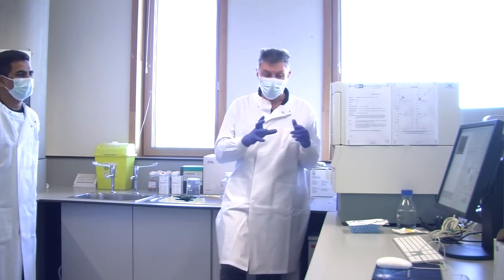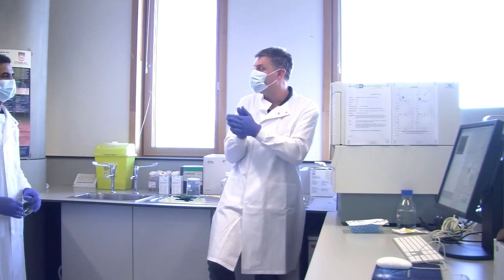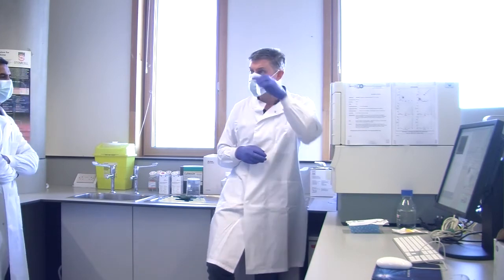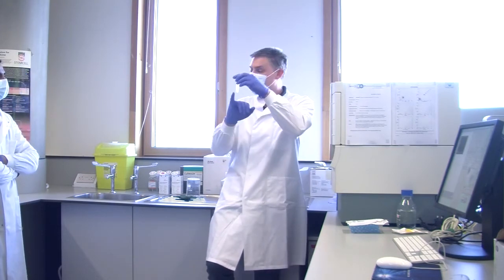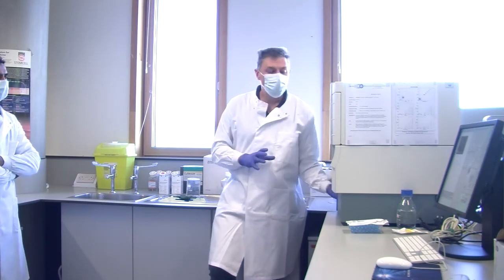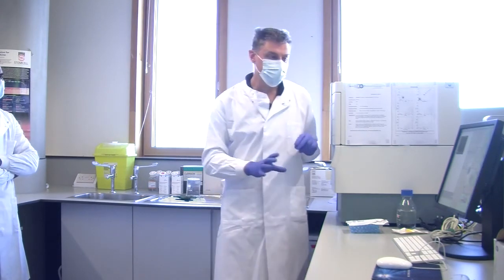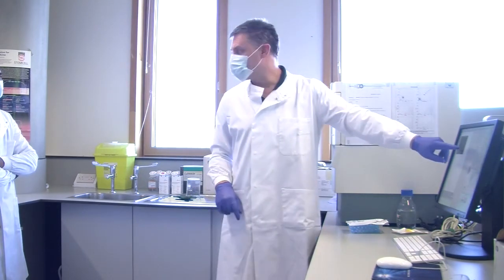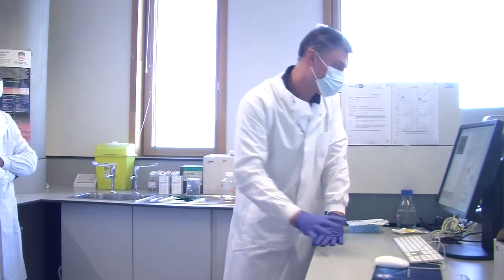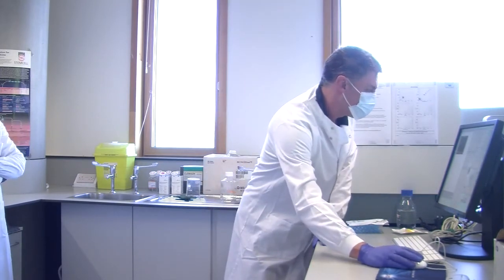Now, normally, if we put a tube of cells on it, they will be cells. But not every single event that goes through is a cell. If I put on my QC tube, these are beads, but they still come through as events. So you've got to remember that not every dot you see will be a cell. But each one of these dots, you can't really zoom, you can zoom in on this and see if this works.